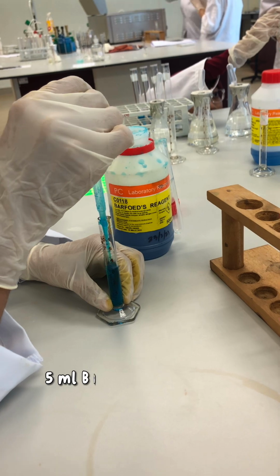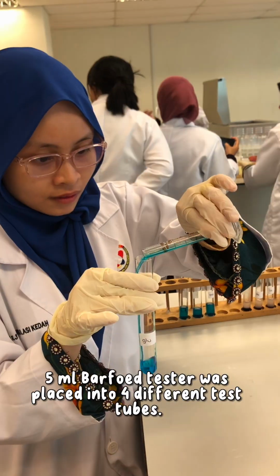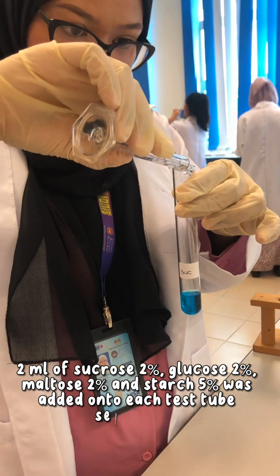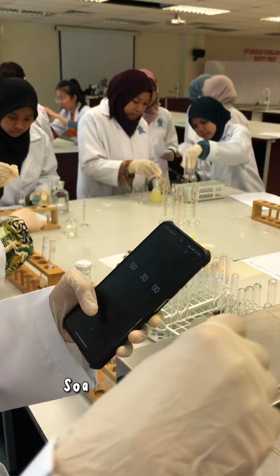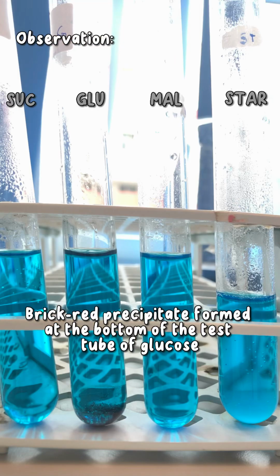Barfoed test. 5 ml of Barfoed reagent was placed into 4 different test tubes. 2 ml of sucrose 2%, glucose 2%, maltose 2% and starch 5% was added into each test tube separately. All of them were soaked in boiling water for 30 seconds. The result was recorded.